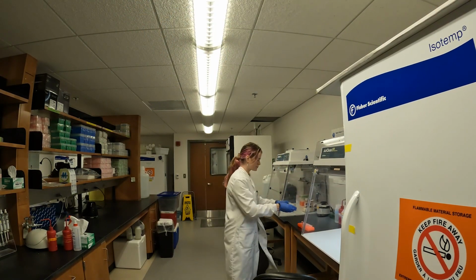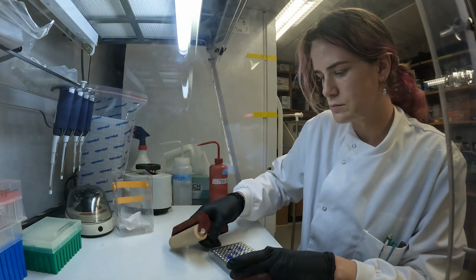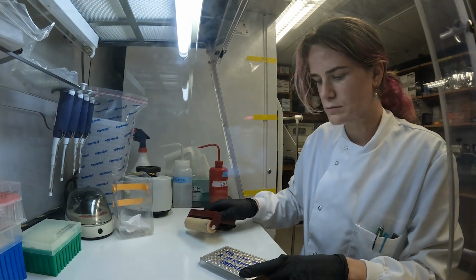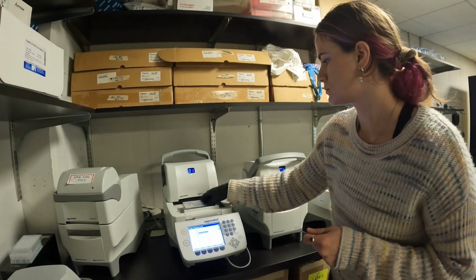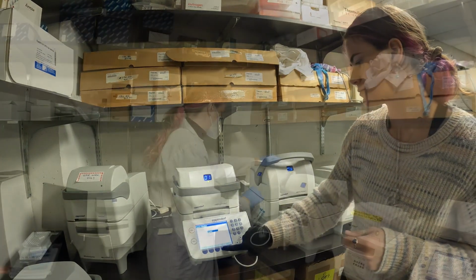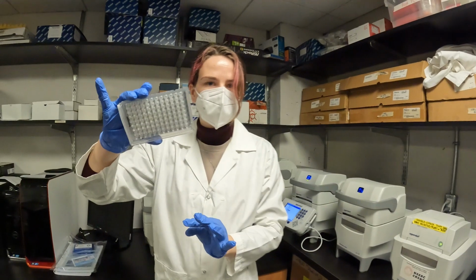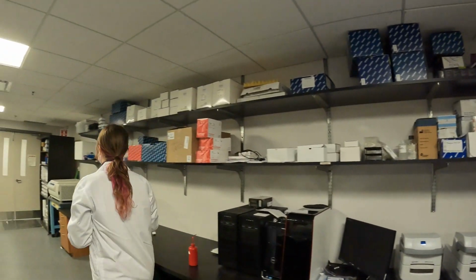Next, we amplify the DNA sample through polymerase chain reaction, or PCR. PCR uses the enzyme polymerase to make millions of copies of selected regions of the genome. They're targeted using short synthetic nucleotide sequences known as primers. We target regions of the genome that are specific to each taxonomic group and can be used as a DNA barcode to identify the organisms in the sample.